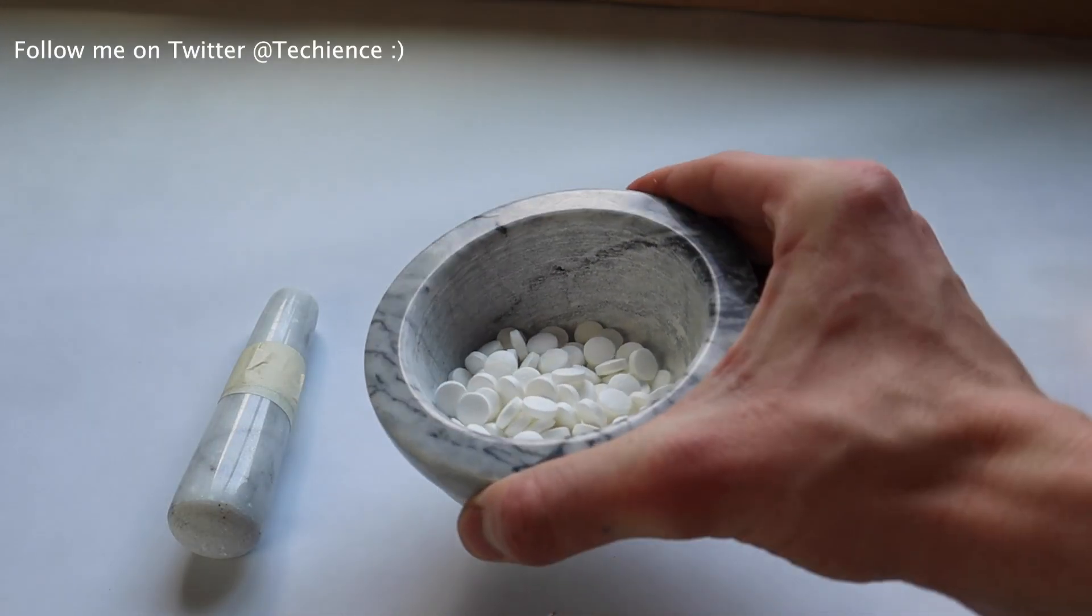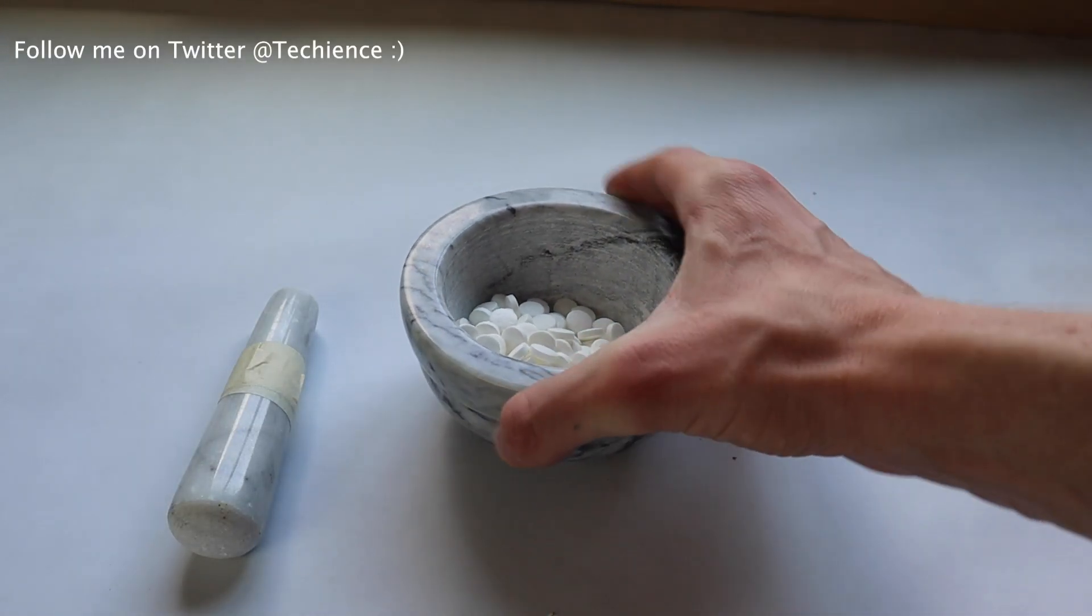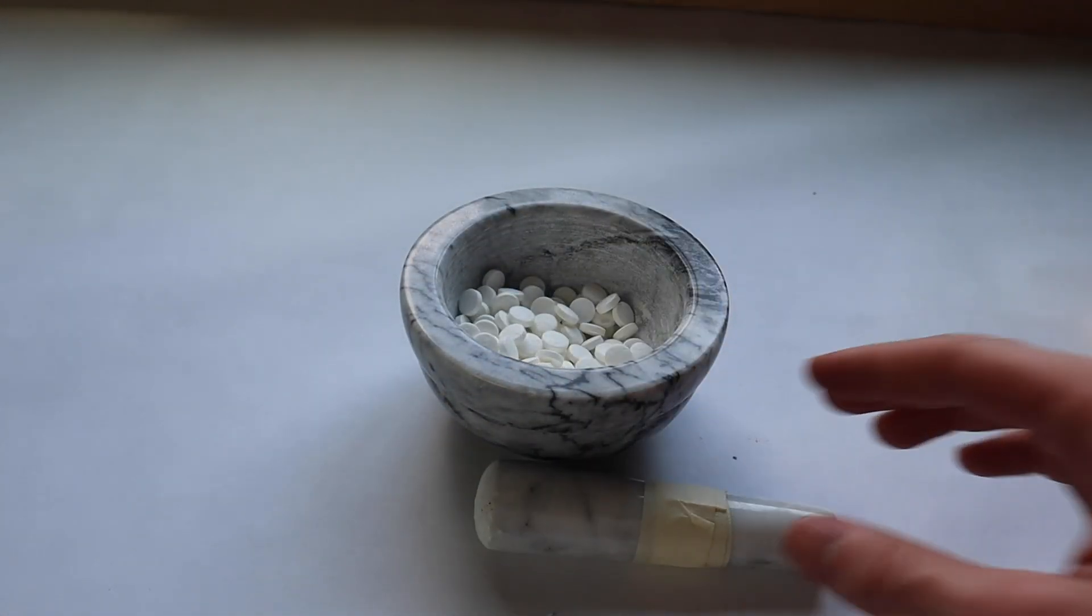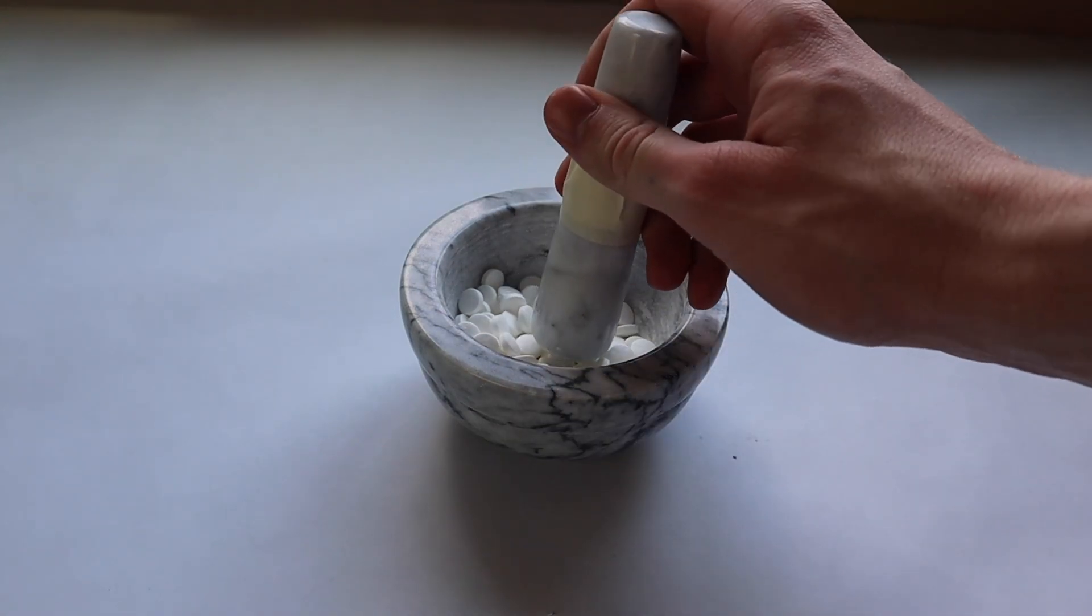So I dumped about 150 tablets into this mortar and pestle and I'm just going to see if I can crush it up. Probably won't be too hard. I crushed one of them and it worked pretty well. So I'm just going to try and crush these up into a powder now.